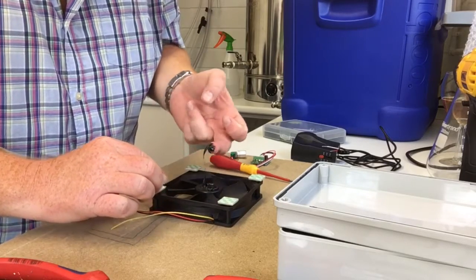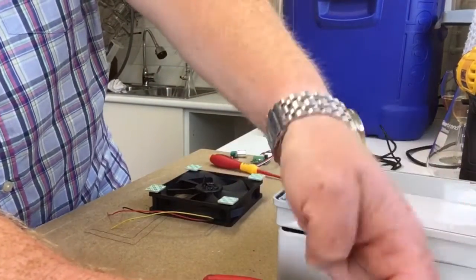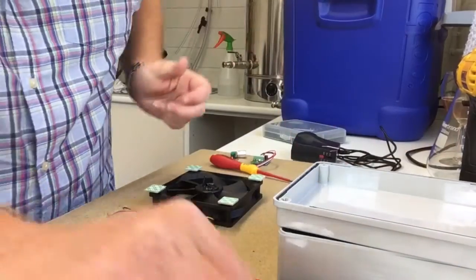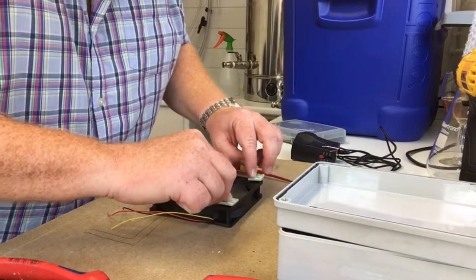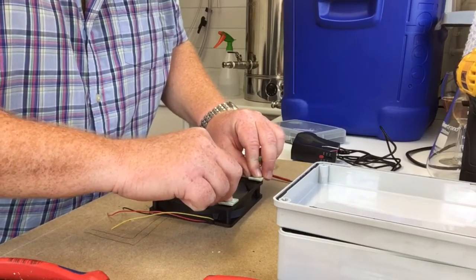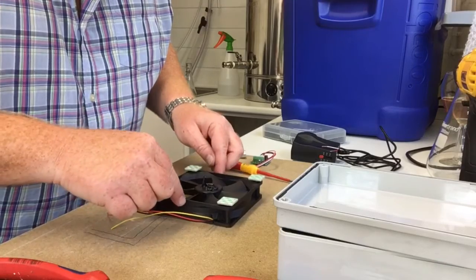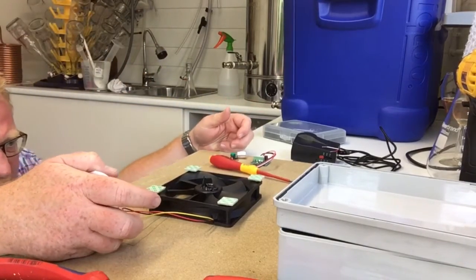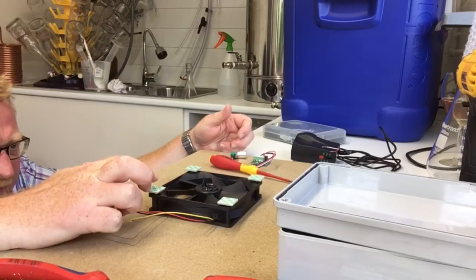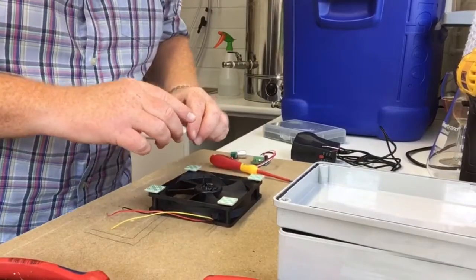Oh, you cock. Why would you do that? Because I'm hapless. Right, so they are spot on. Check the level. Yeah, I'm not going to touch them anymore. I'm not going to do any more with them. Let's get this mounted.